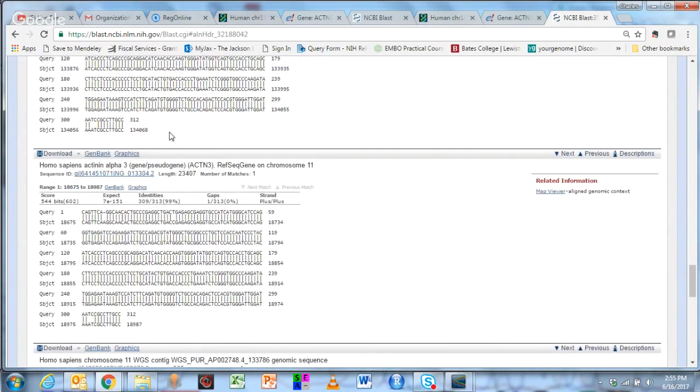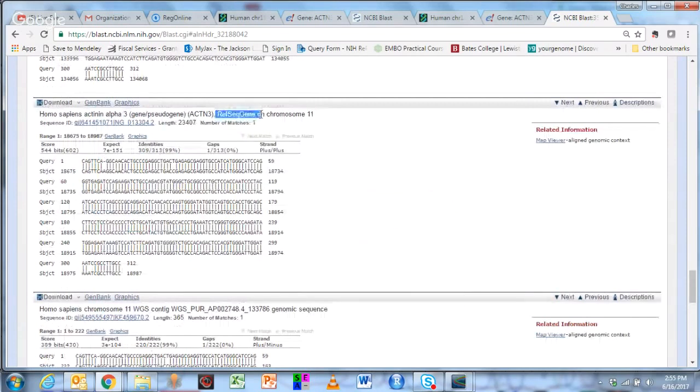If you look at the actual reference sequence gene, which is the curated gene that's known on chromosome 11, so this has been professionally looked at, there is probably a sequencing error about 8 bases in. You'll see this is our arginine codon in our sequence as a TGA, which would be a stop codon, and here is the CGA, which is the normal or reference sequence, hence the reference sequence gene. So this is a good way to show the students that the sequence is indeed human.